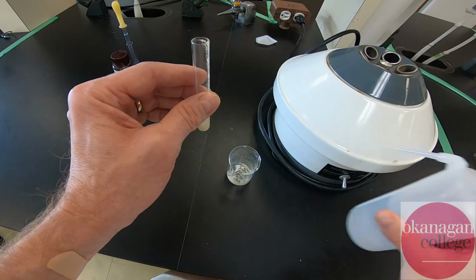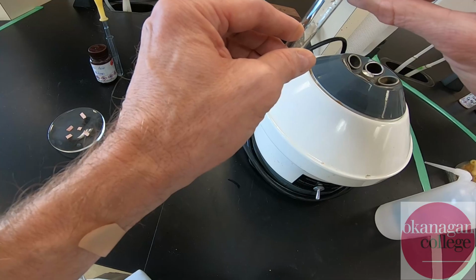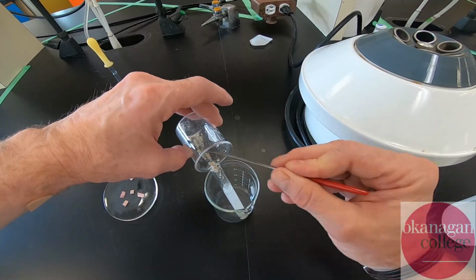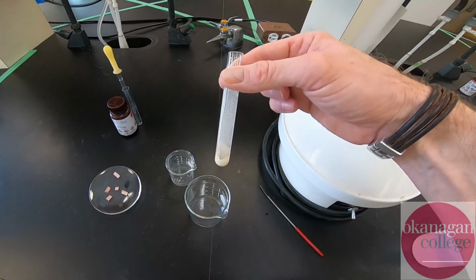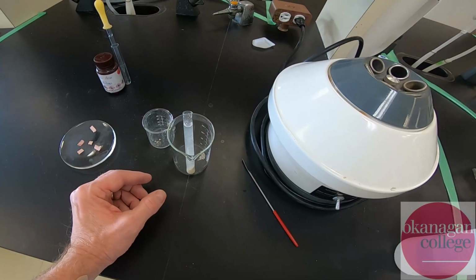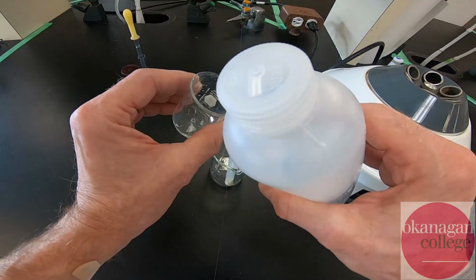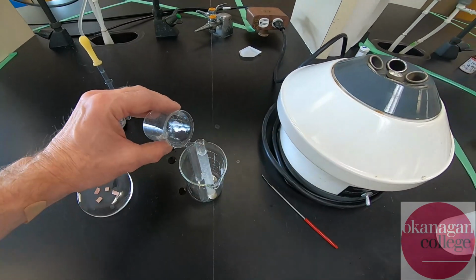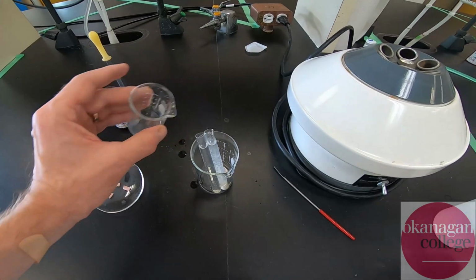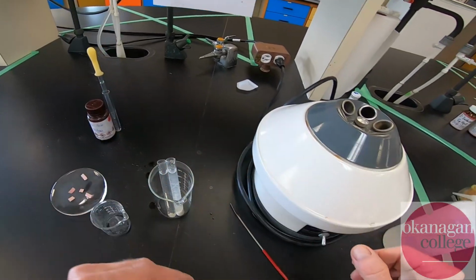And again, loss of material through transfers is probably a legitimate observation here. So for the most part, things are fairly well established. You know what, I'm going to use a second test tube to get that last little bit. All right, so give myself a little extra room. Oh, the added benefit here is I'll be able to use both test tubes. One is a counterbalance to our centrifuge.